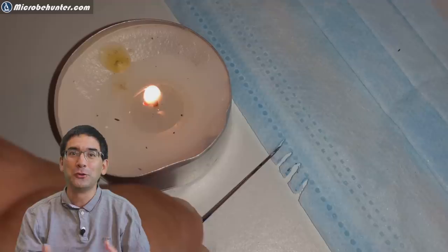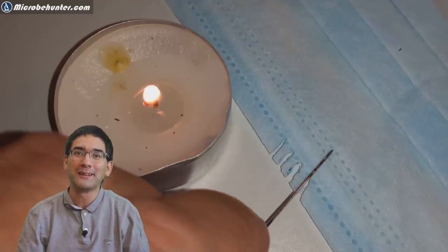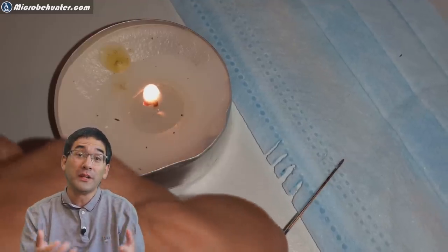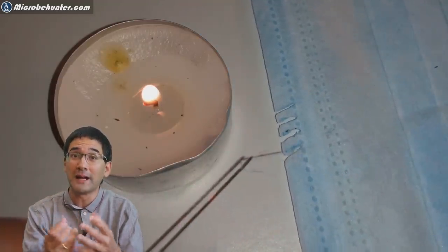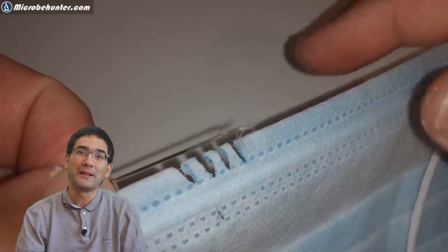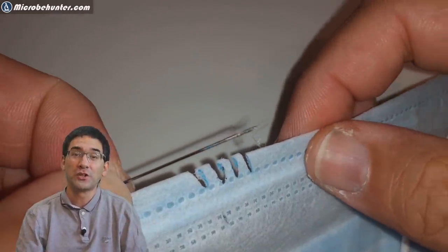It's quite easy. All you have to do is heat up a needle over a candle. When it's cotton, the cotton will start to char and become black, but when it's an artificial fiber like in this case, it actually starts to melt.